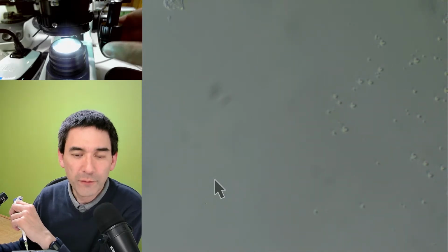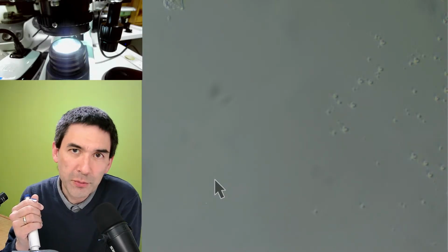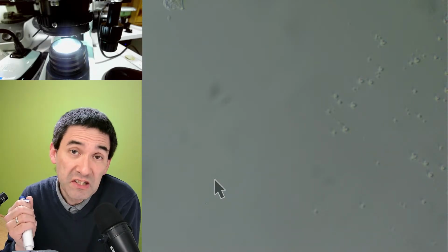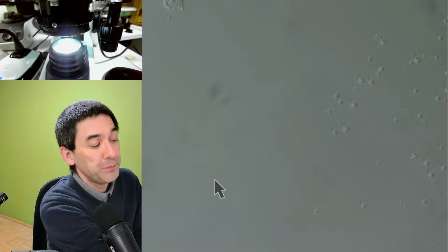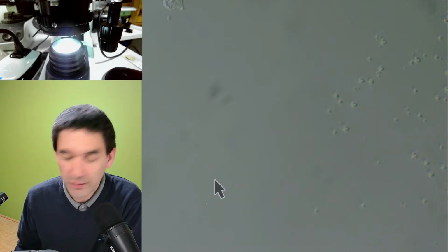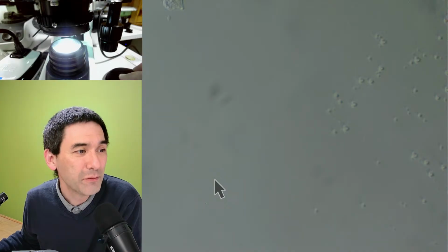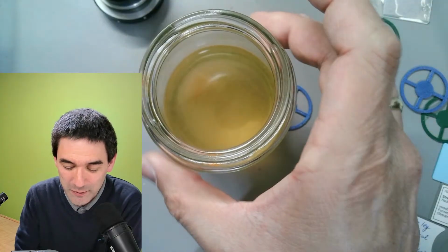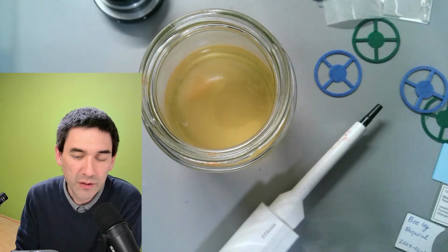So what I've done with those vinegar eels is I added regular vinegar, 50% vinegar, 50% water, and a spoonful of table sugar, and that's it. And I keep on growing it. I got those vinegar eels from a colleague at work, who keeps a home aquarium, and he gave me a jar a couple of years ago, and I've been growing them ever since. Every time I need more, I take some sample out and transfer it into a different jar.